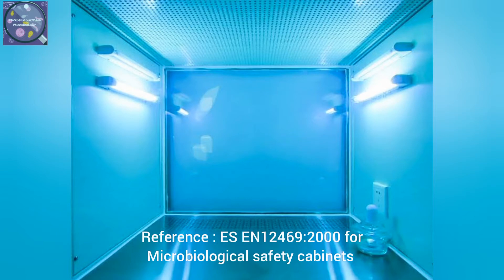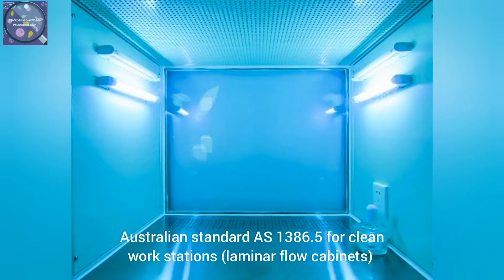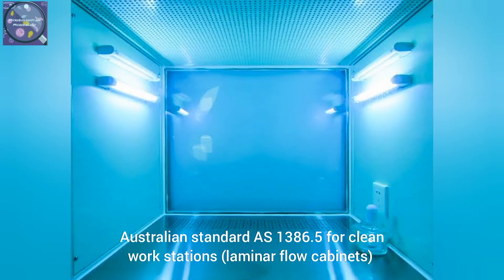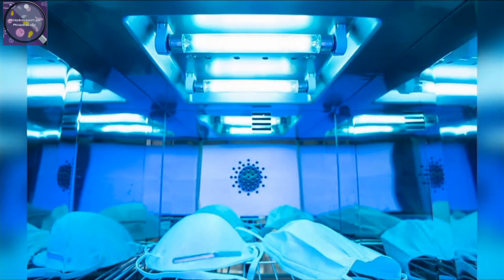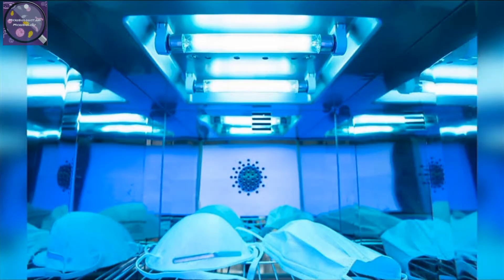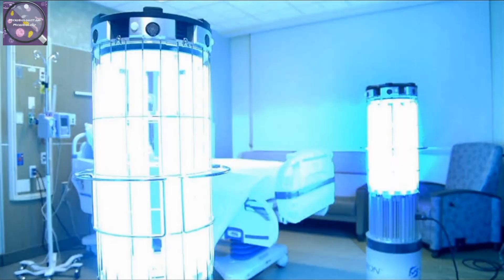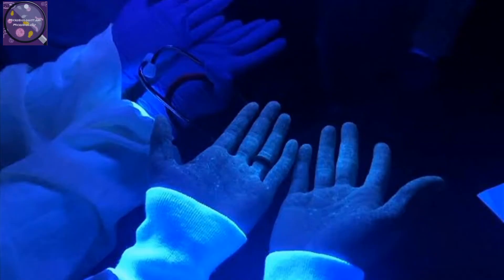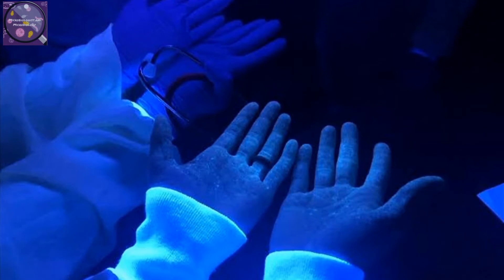The UV lamp is activated while the cabinet is not in use, to keep the interior of the work zone clean and decontaminated — for example, throughout the night until the user returns the next day, or before 2 hours or 6 hours of use.